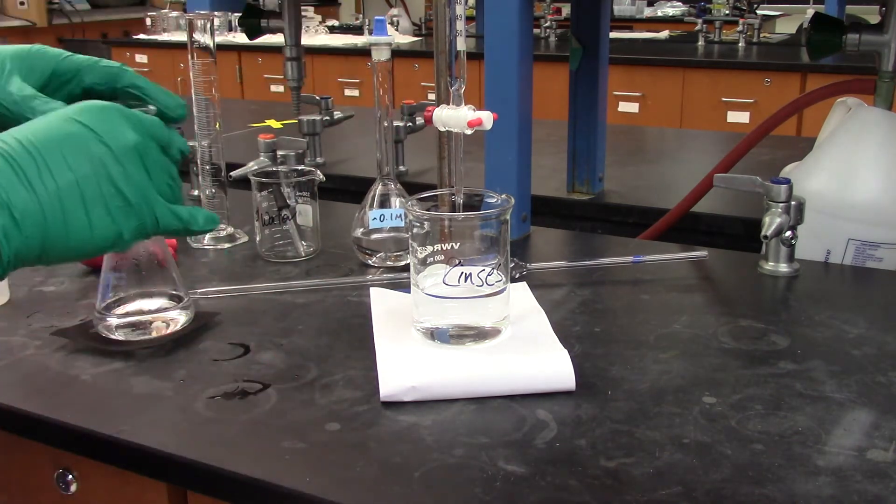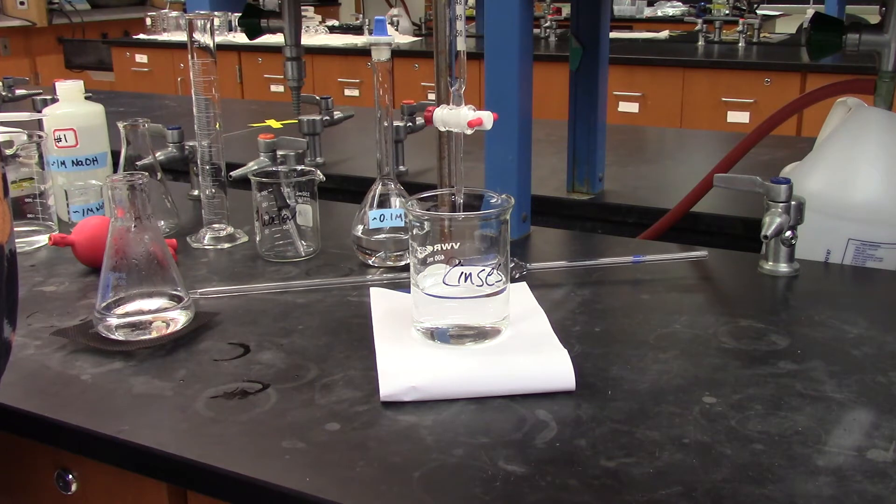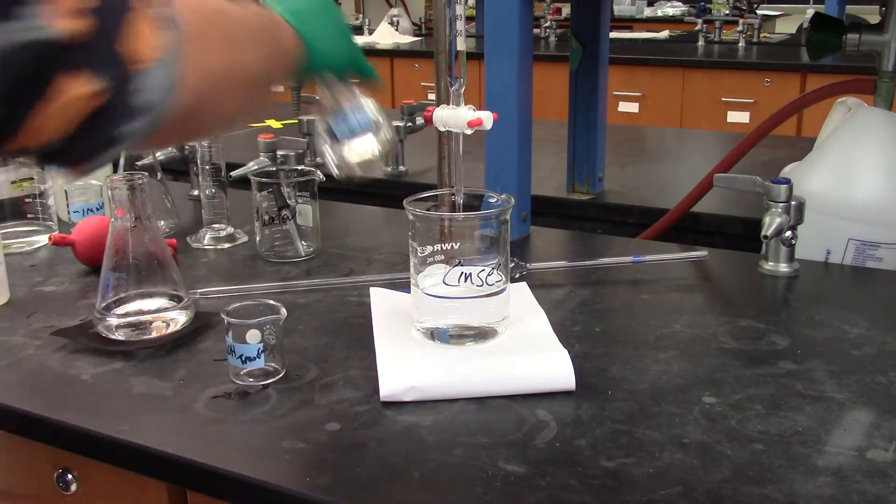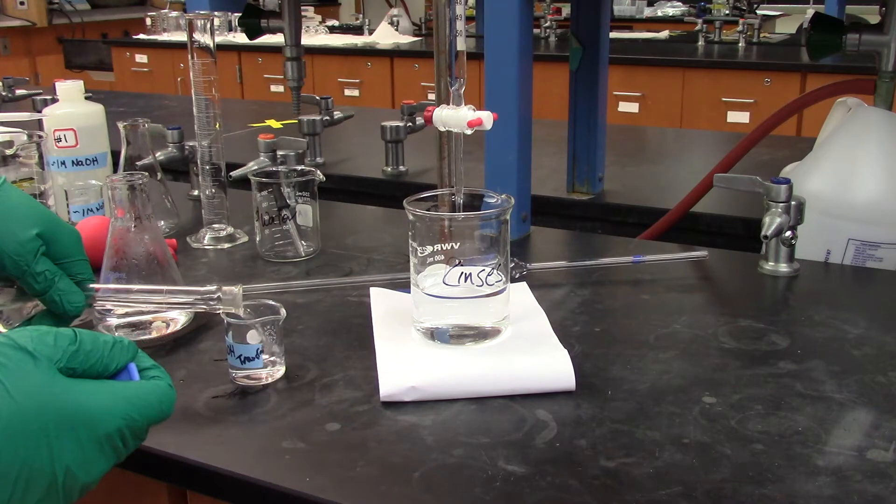So we're ensuring that the solution that is in here, which is our dilute sodium hydroxide, is at the same concentration as in the original flask. All this rinsing with water can make your solution diluted.